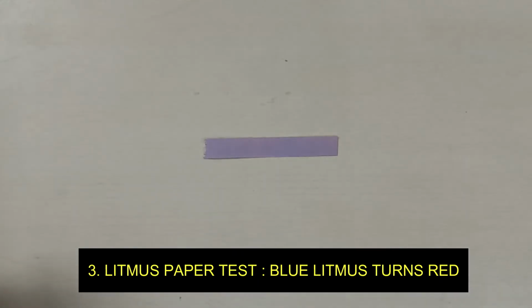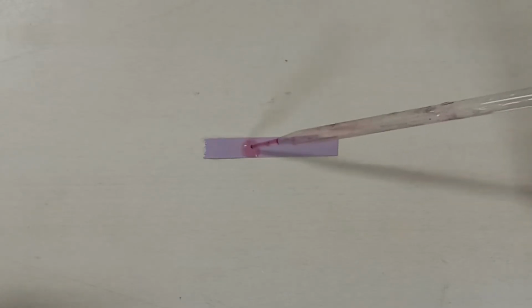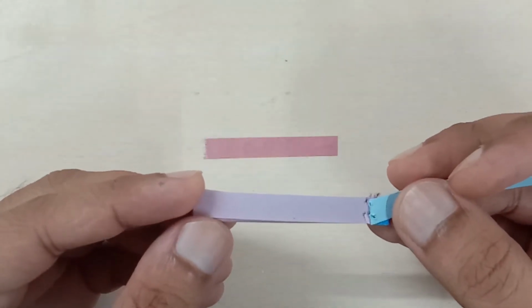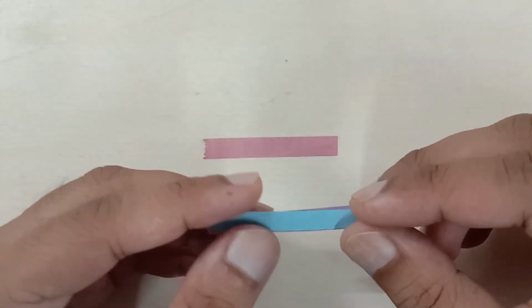Next is the litmus paper test. So we have a blue litmus paper, and I have already filled this dropper with the acetic acid. So let me add a few drops of the acetic acid, and we are seeing that the blue litmus paper has changed into red, right? So this was the blue litmus paper before adding the acetic acid. Now it turns red, which means that it is an acid, but it's a weak acid, guys.